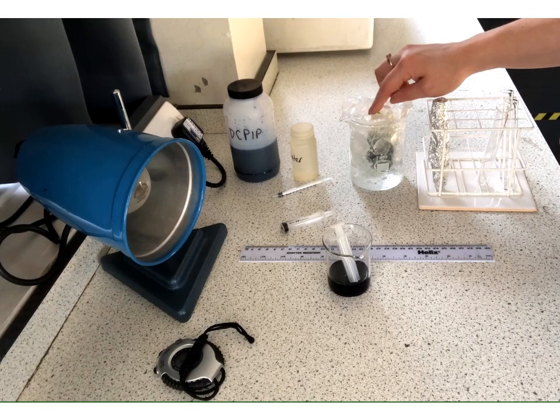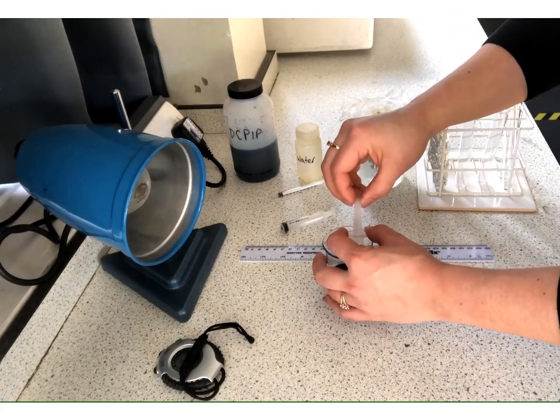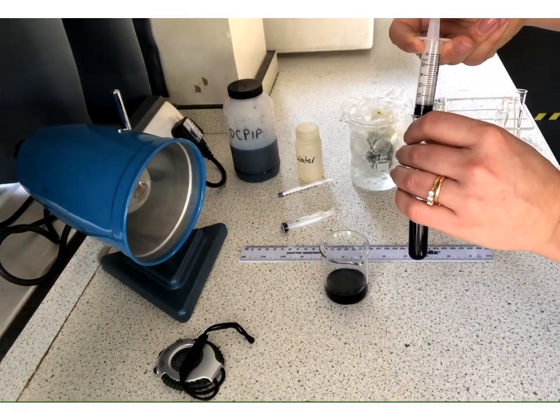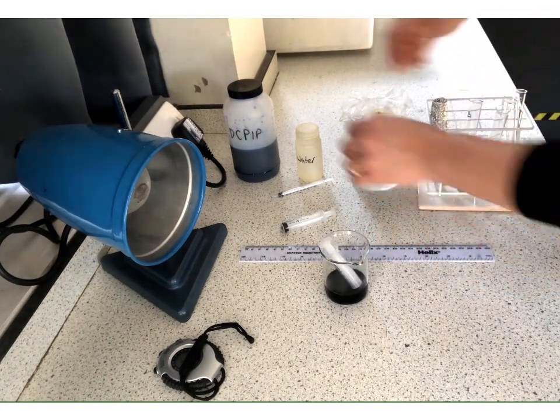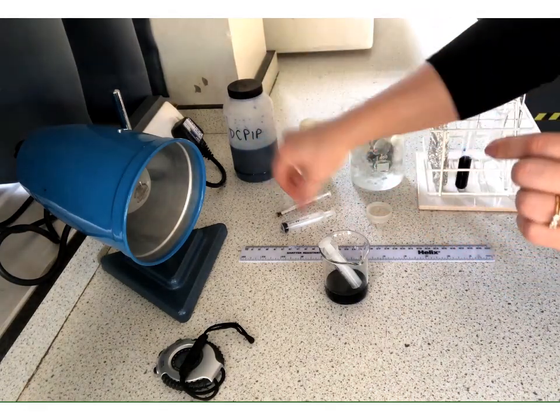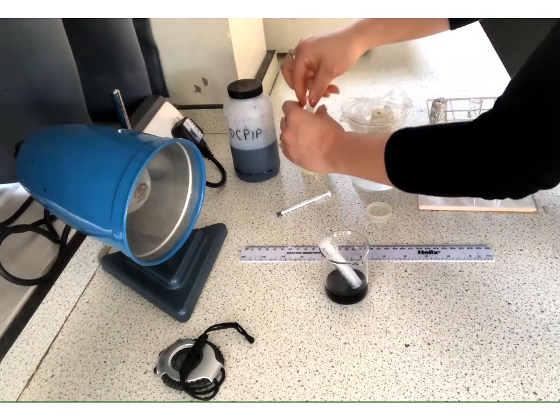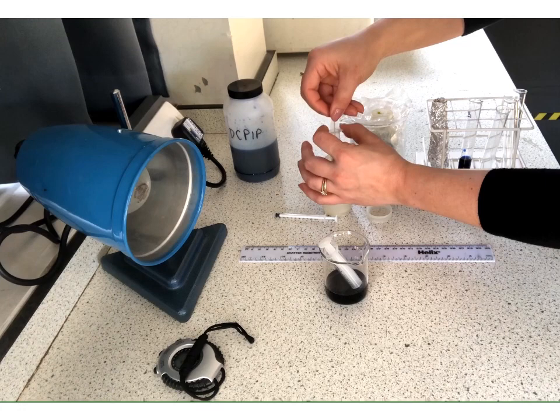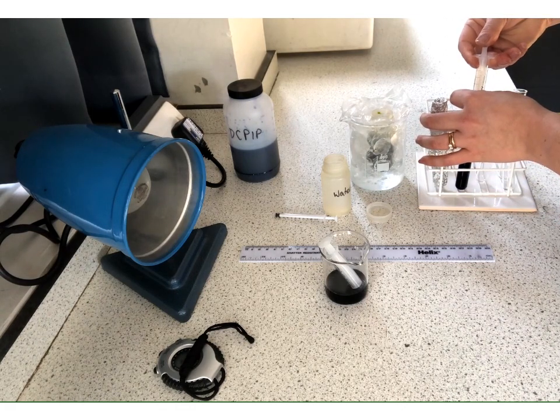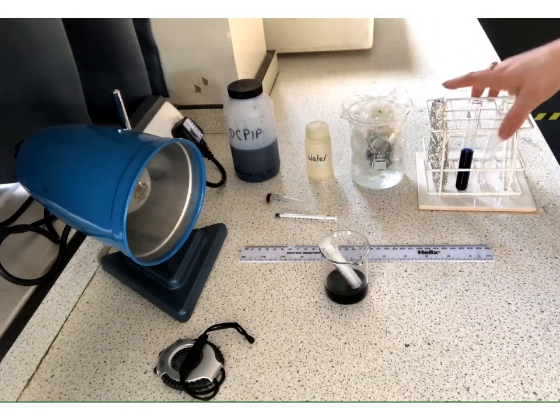We don't want the chloroplasts this time, so instead we're going to double up on the water. So another 5. And this time, rather than using 2 rounds of the smaller syringe, this one only goes up to 1 centimetre cubed, we can use a slightly larger one, a fresh one, that goes up to 5, because then we can measure to 2 quite easily. Okay, and we are not putting any chloroplasts in there because this is going to hopefully show us that it is the chloroplasts that are having effect. So those are our controls now set up.